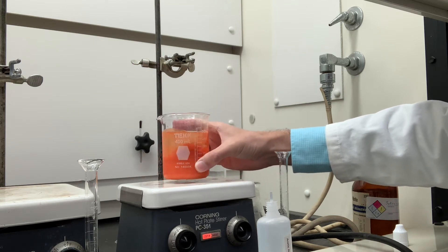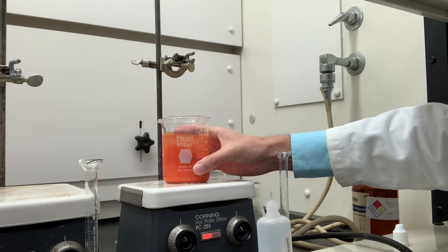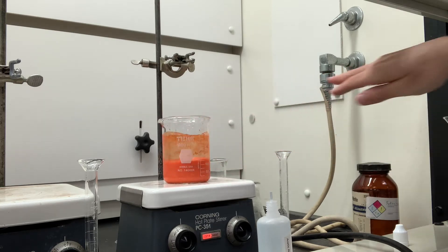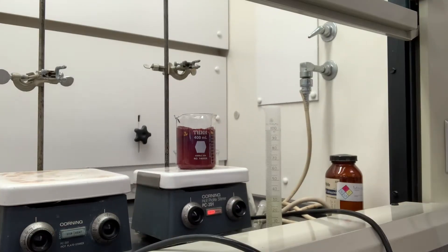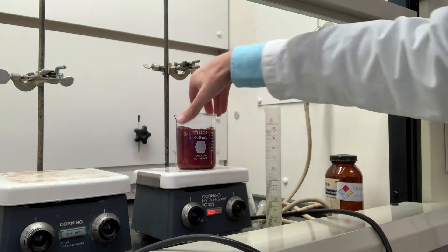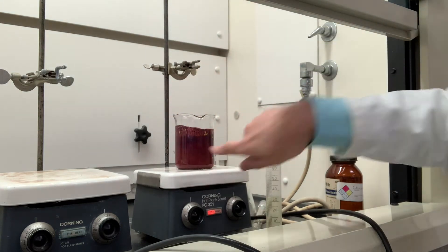So I'm just going to let that stir until the ice cubes melt. Like I said, probably about 20 to 30 minutes. We finished stirring this for quite a while and you can see how it's a dark red color.